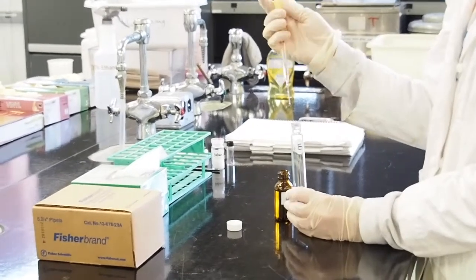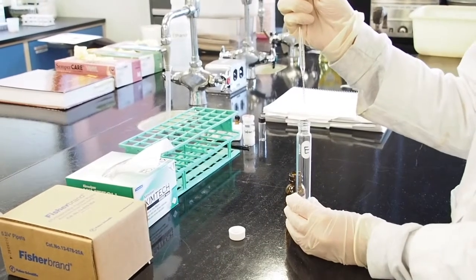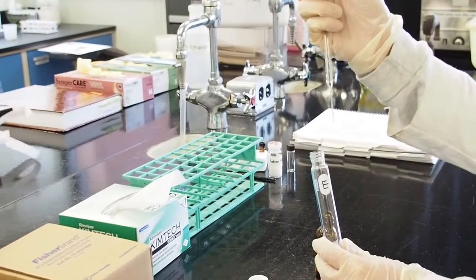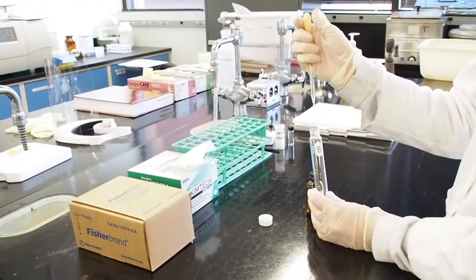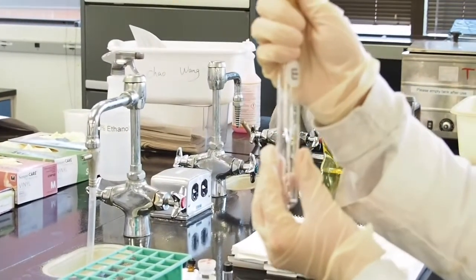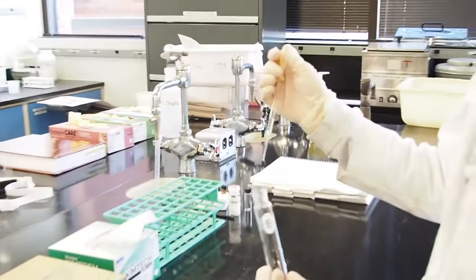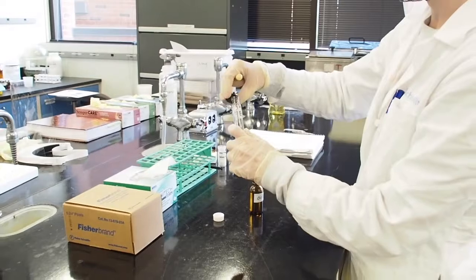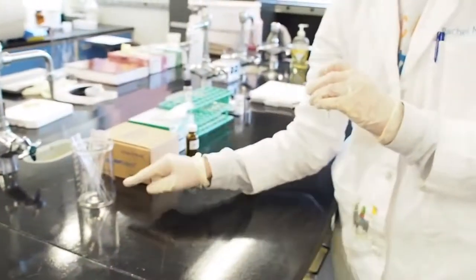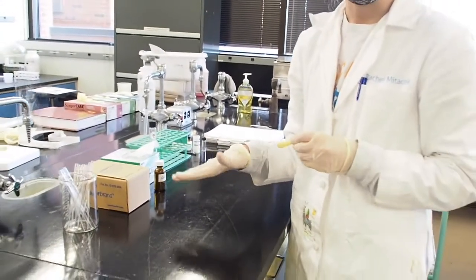So when we're adding the oil in, you don't want to hold your dropper just like this above it, because it could get on the sides or it could drop over here. And for the steps that we have coming up, we want to be able to get those 2 drops all the way at the bottom. So I'm going to put my dropper down there and put 2 drops at the bottom, and then carefully pull it out, and I'm going to cap my tubes. There will be this beaker here for you to dispose of your pasteur pipettes into, and then we'll put those all in the glass disposal at the end.